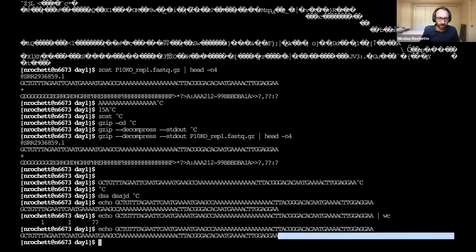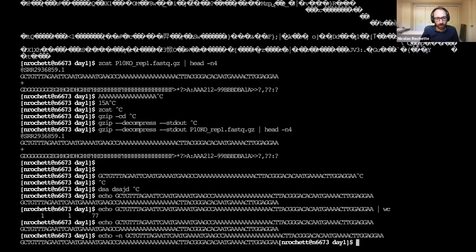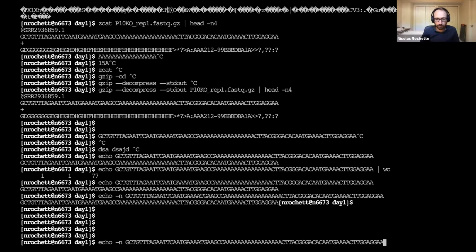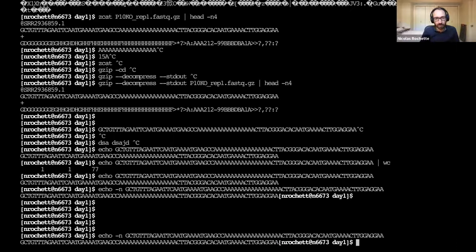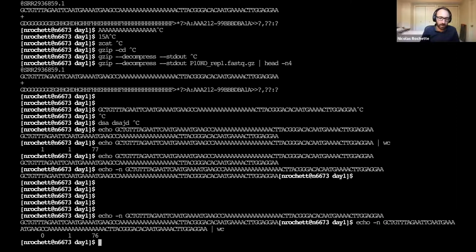So going from there to there and back at the beginning of the line. What we can do to avoid this is add the -n option, which is for no new lines or something like this. And then we don't have this new line. There's nothing there. So now if we use echo with -n and word count, we have this 76, which matches what we had in the table. And there are plenty of ways to do it.